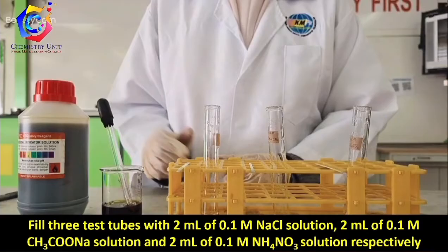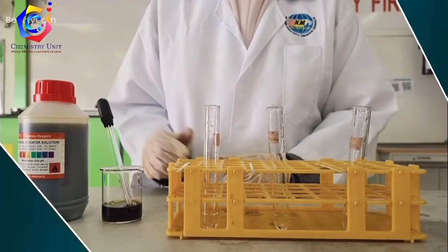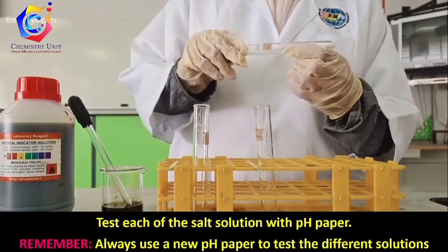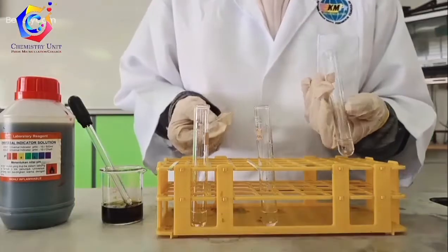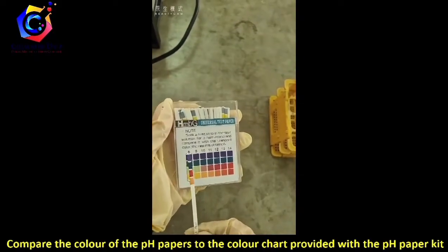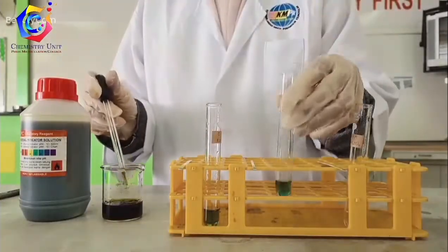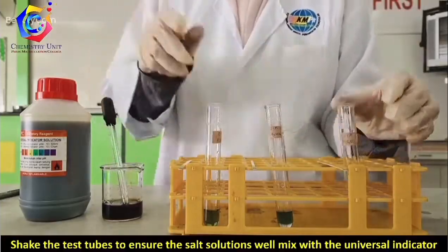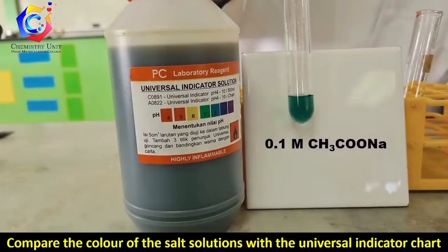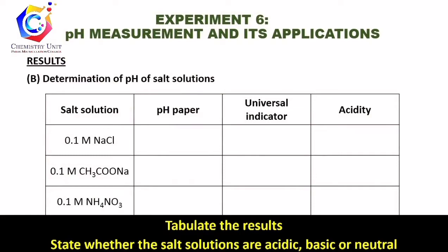For part B, fill 3 test tubes with 2 ml each of 0.1 molar sodium chloride solution, 0.1 molar sodium acetate solution, and 0.1 molar ammonium nitrate solution. Test each salt solution with pH paper — always use a new pH paper for different solutions — and compare the colors to the color chart. Using the same salt solutions, add 2 drops of universal indicator to each test tube, shake well, and compare the color with the universal indicator chart. Tabulate all results and state whether each salt solution is acidic, basic, or neutral.